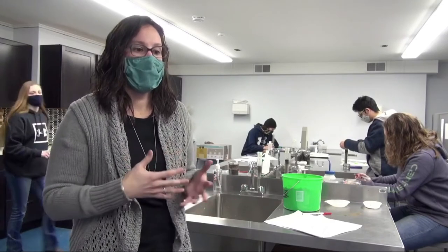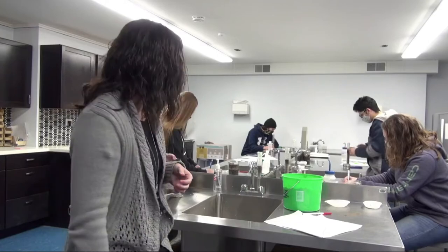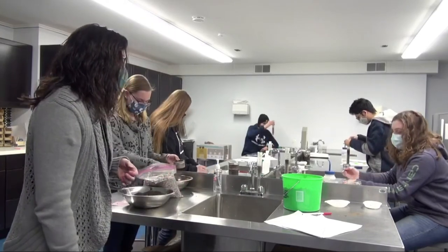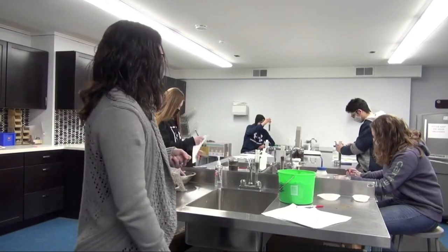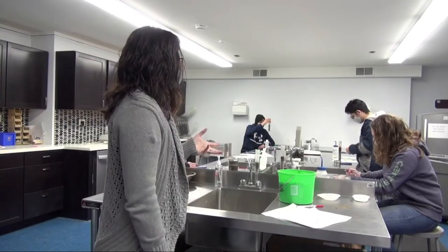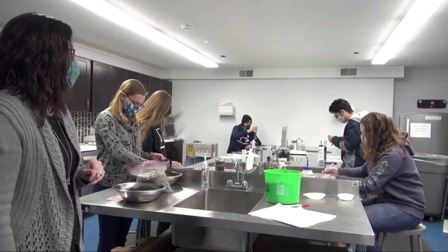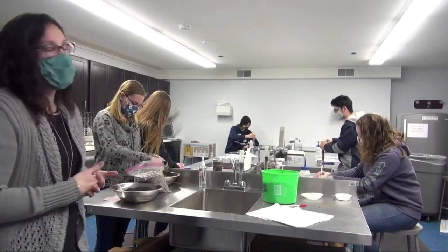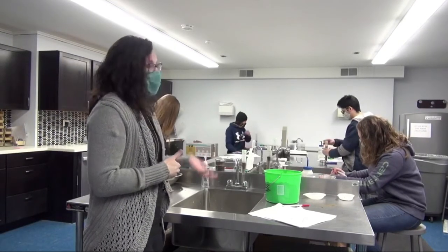Students are also talking about the water within the soil. So soil water, there's a couple different types of soil water. When you see some graduated cylinders here, we're filling those so we can measure the field capacity of a soil. And technically, field capacity water should make it through the soil and kind of out of the way within 48 hours.